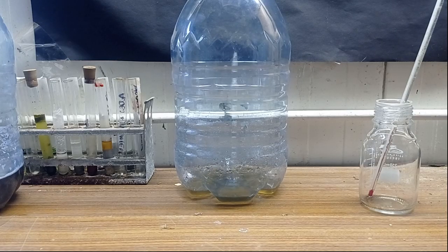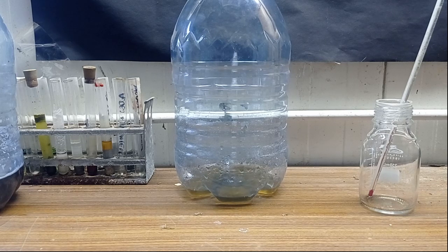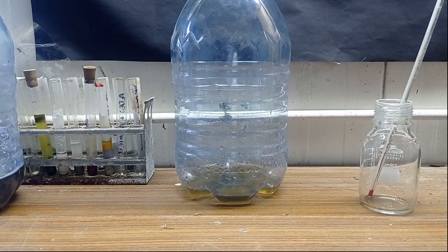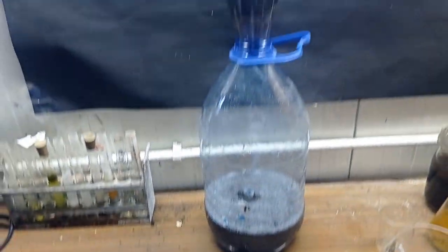There was a lot of ash and other impurities, so obviously I had to filter it, this time with not so great force of gravity. After that I had to filter it again.